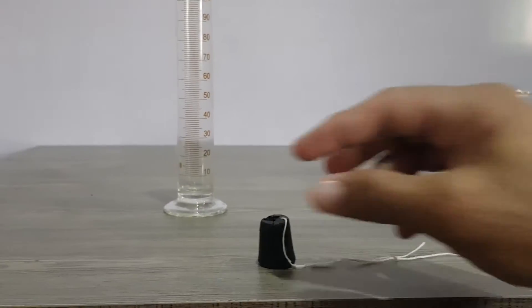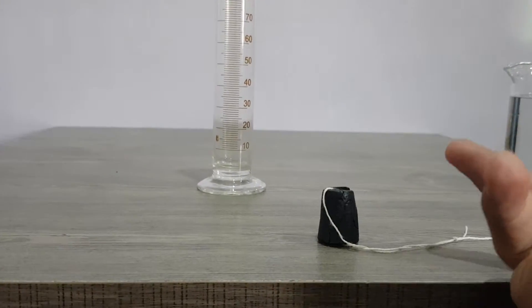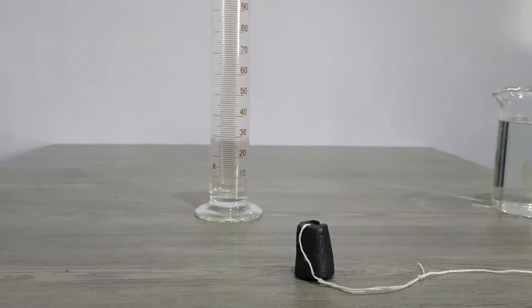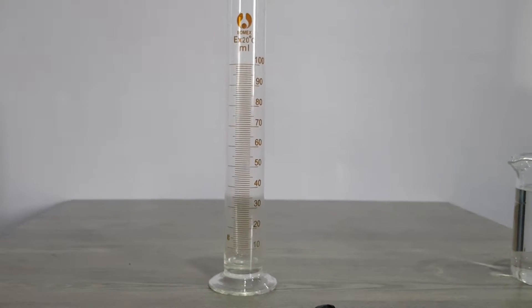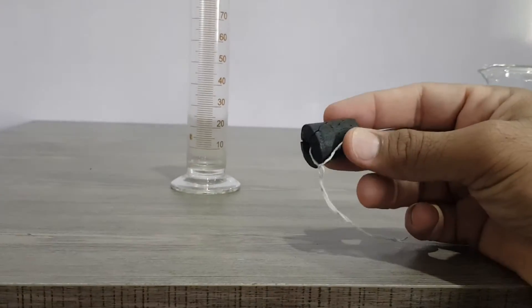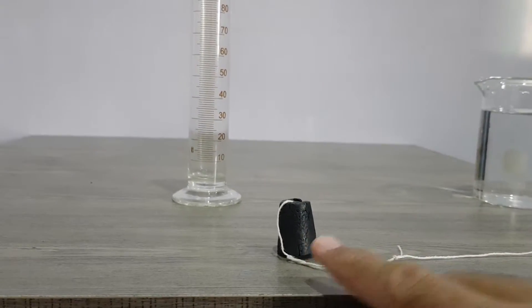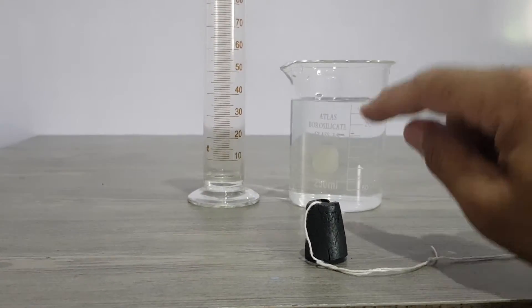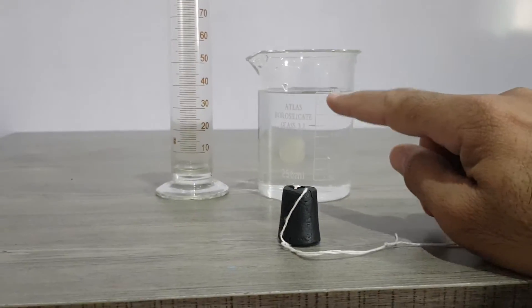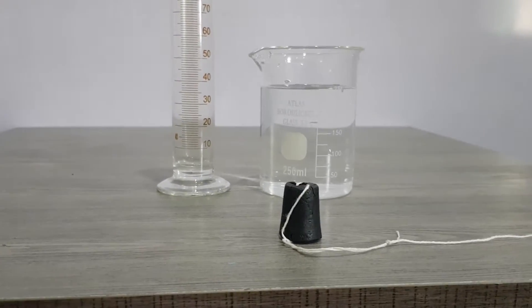Another use: suppose you have a solid of irregular shape, like a stone. You can find the volume of that stone with the help of this measuring cylinder. There are two conditions for such bodies: first, the substance should not dissolve in water; and second, it should sink in water — it should not float on water. If it floats, we cannot find its volume this way.